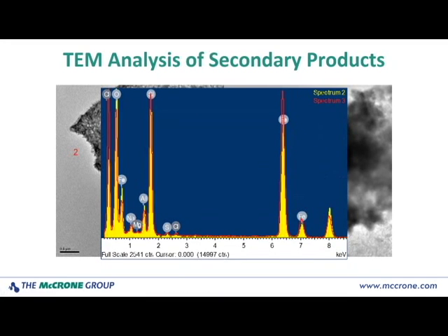And analysis of several areas showed that these actually had consistently different compositions. This was an iron-containing API, and the products that I found were high in silicon and also high in iron, but consistently showed two different silicon to iron ratios, depending on whether the morphology was the needle-like structure or the more fluffy or amorphous looking structure. So if you look at these spectra which have been normalized on the silicon peaks, you can see that you have a lower iron to silicon ratio for the yellow, the spectrum 2. So two distinctly different products forming, but possibly also an indication that you've got a process going on of continuous dissolution of glass, reaction of glass with the iron-containing API, and then forming a product that may eventually finalize at a given iron to silicon ratio. But certainly something going on beyond just glass delamination.